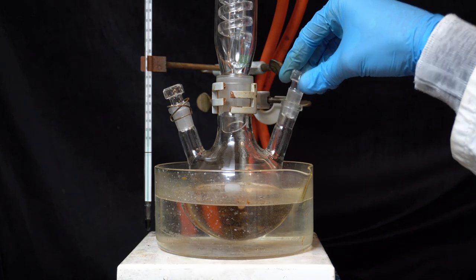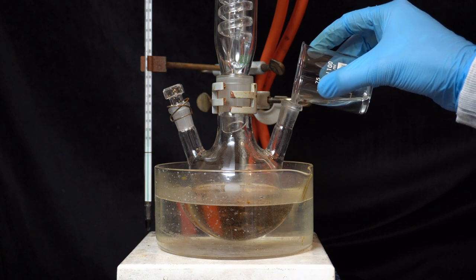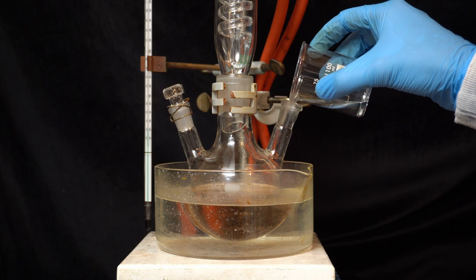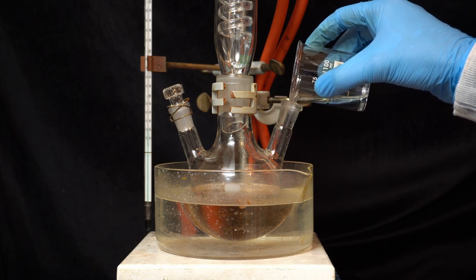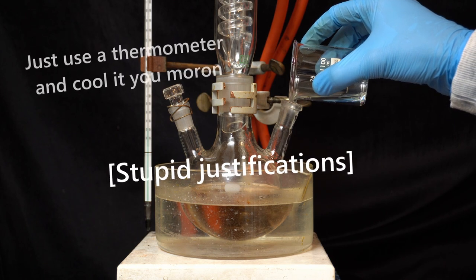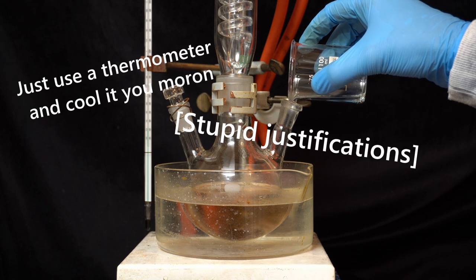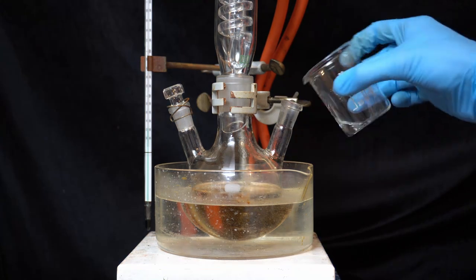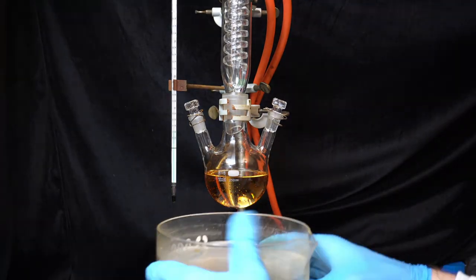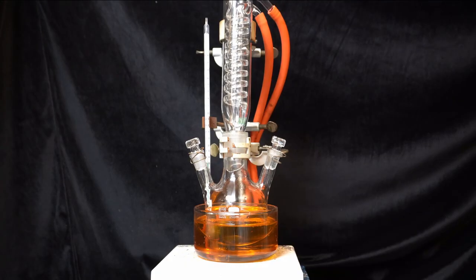After a few minutes this has cooled down enough that I can add the rest of the aniline. I could have used an addition funnel here to add the aniline slowly, which would have prevented the boiling issue, but then I would have had to clean it and I am lazy. Besides, it's not really a big deal that it got hot because I'm going to reflux this anyway. I rinsed the aniline beaker with some more acetic acid and put an oil bath below the flask. The mixture is now refluxed for one hour to push the reaction to completion.